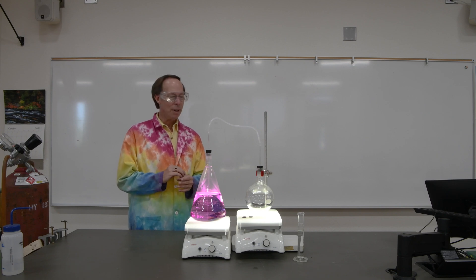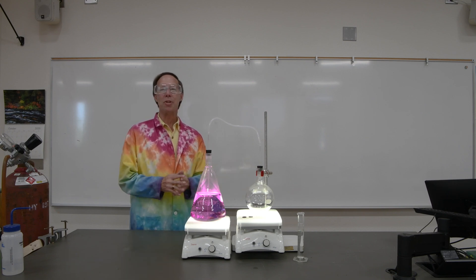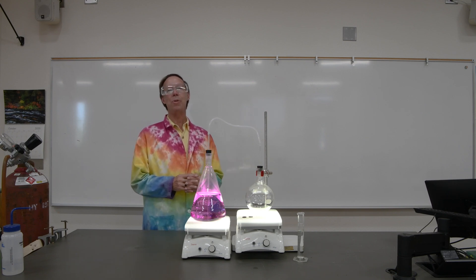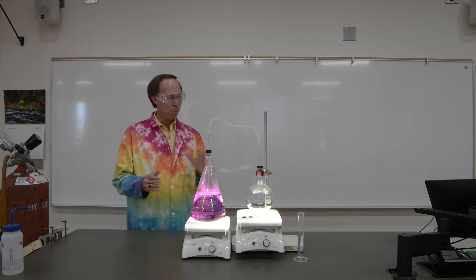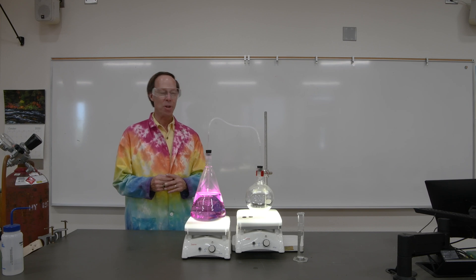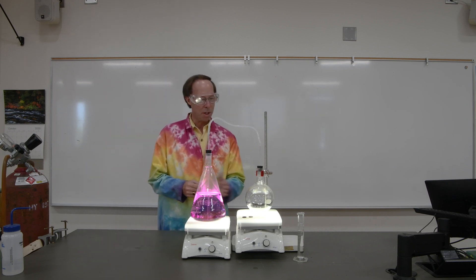He remembered that the rest of his life, and so we have a demonstration that chemists like to do, which is called the Ira Remsen demonstration. We're going to do it in a little more controlled fashion here by reacting our pennies with nitric acid inside this flask.